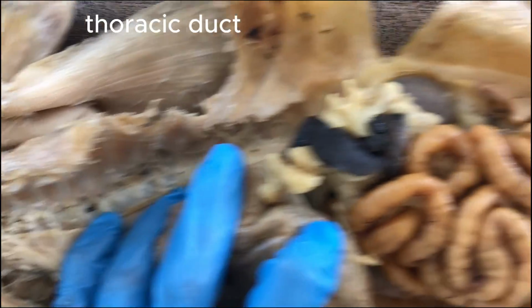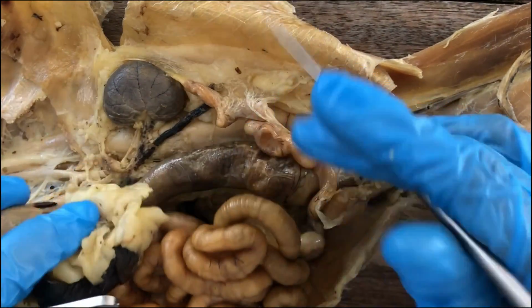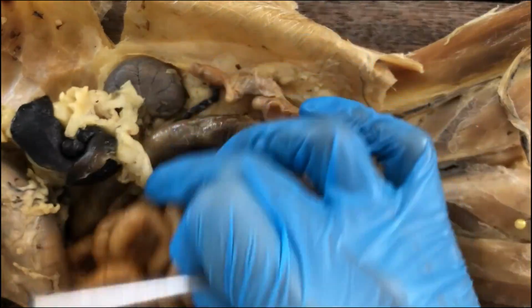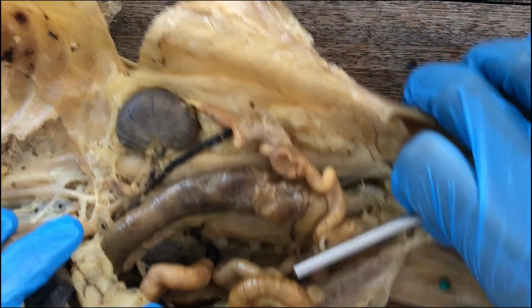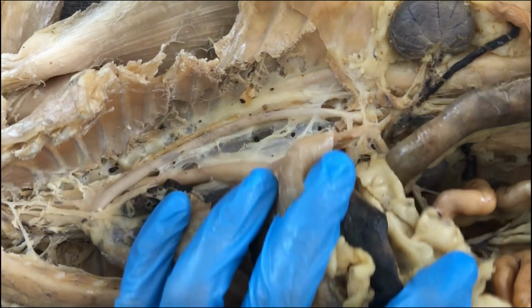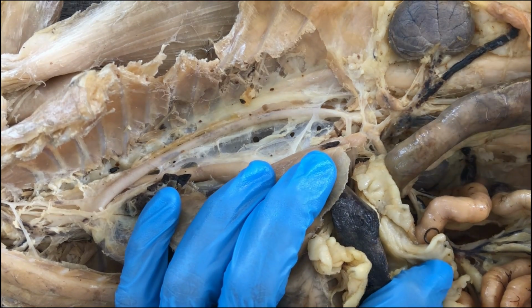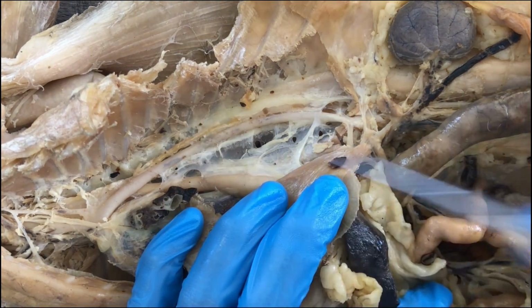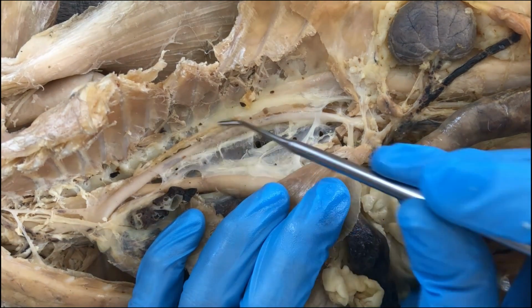If you review your digestive physiology, fats that have been absorbed by the intestines do not go directly into the blood circulation. They have a different route via the lymphatic system. And so that fatty lymphatic fluid will, from the viscera, be drained by this thoracic duct.